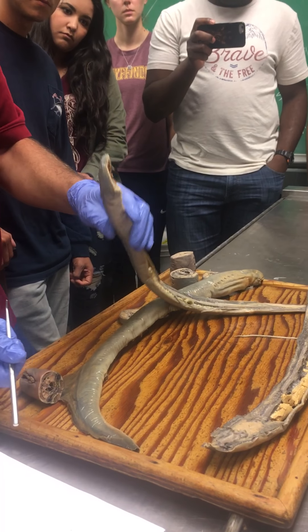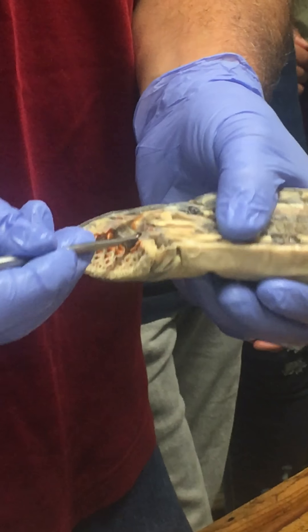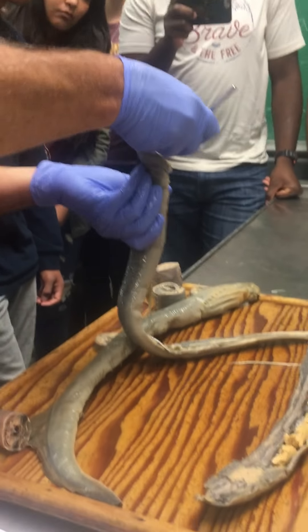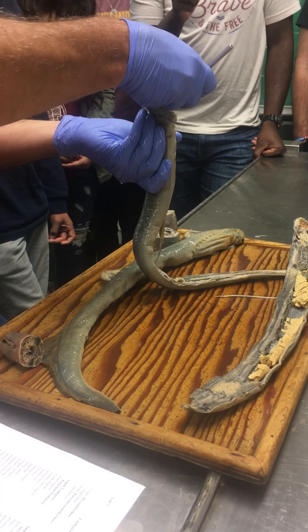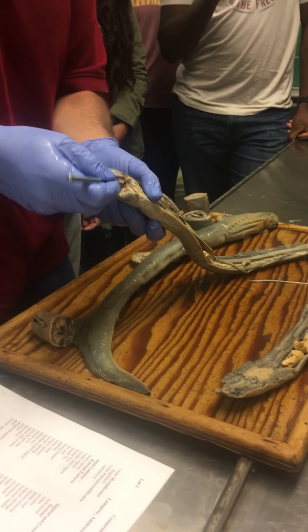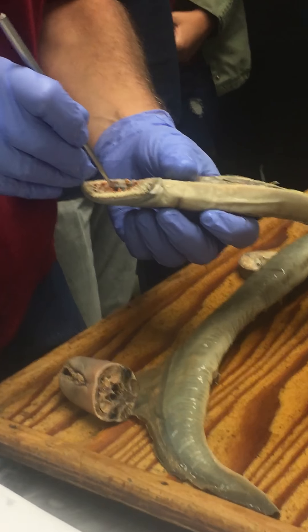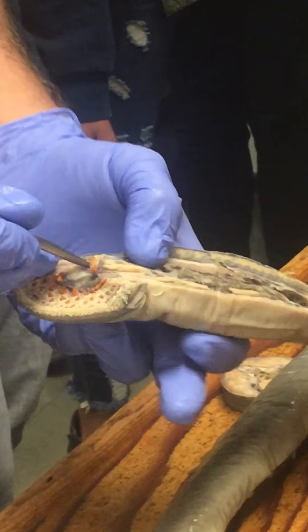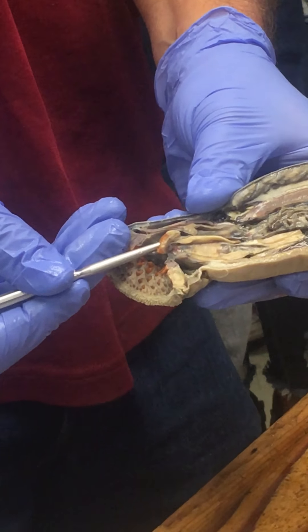The tongue or piston is this structure here, and it's a little obscure if you don't actually make an effort to separate it out. You can see that this has got some horny teeth at the tip of it, and that's what's used to actually rasp a hole in the side of the fish they're feeding on. Technically the mouth opening is behind the tongue or piston, leading back into the gut cavity.